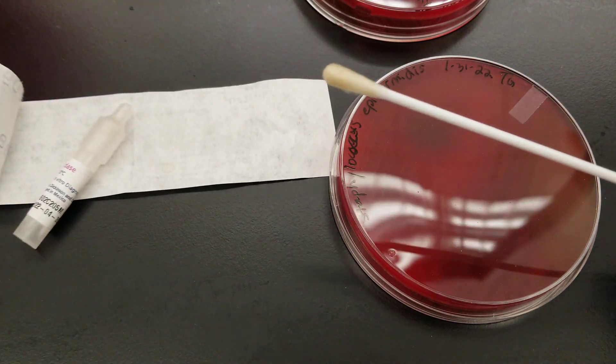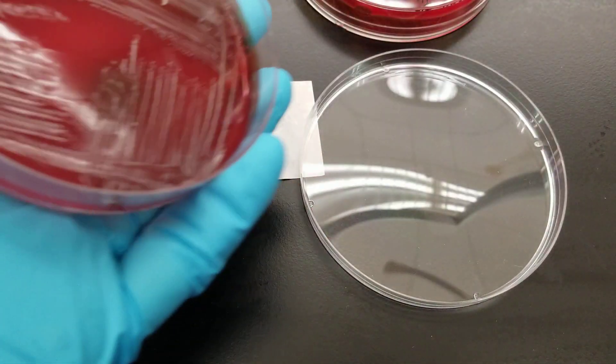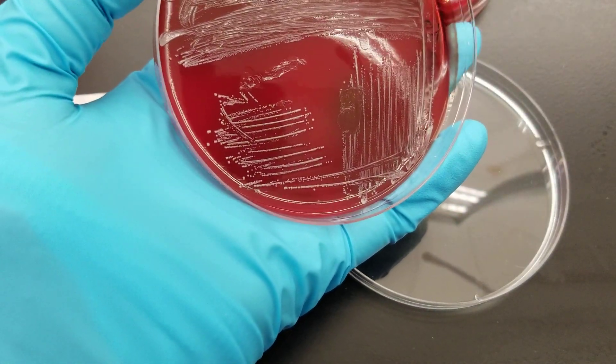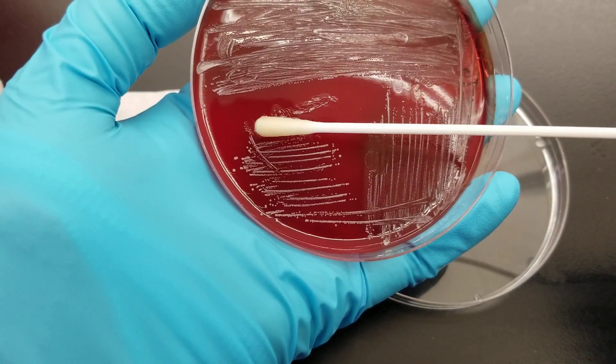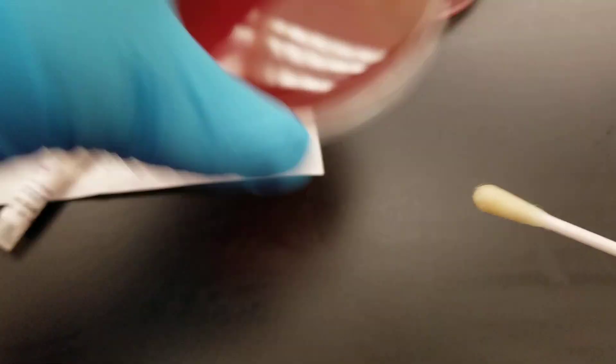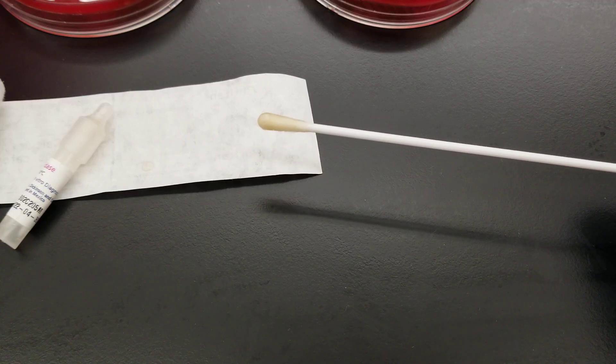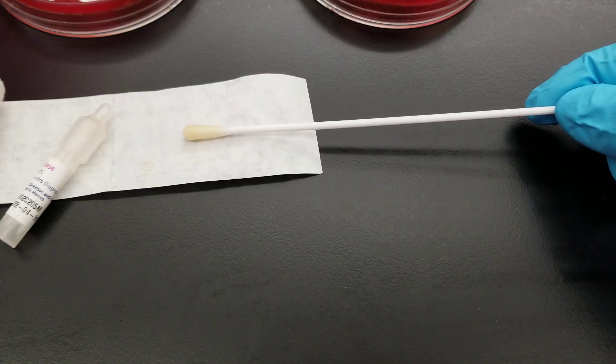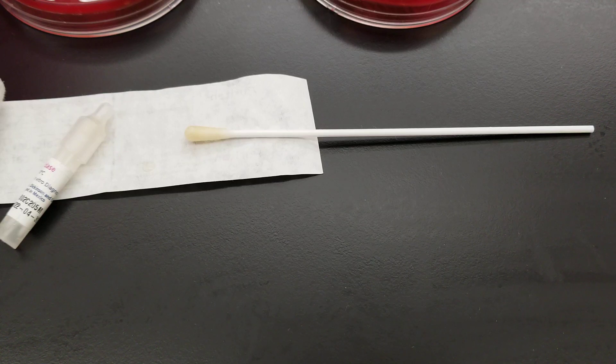Now let's do a negative, which would be the staphylococcus epidermidis. These are pure cultures. I'm just going to pull up, and we're expecting this to be negative. So there is no immediate change. I didn't pull out a timer because it's not going to change.